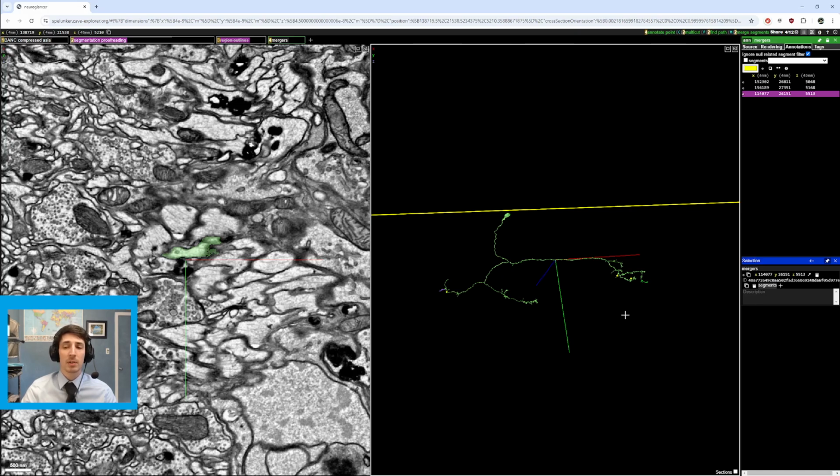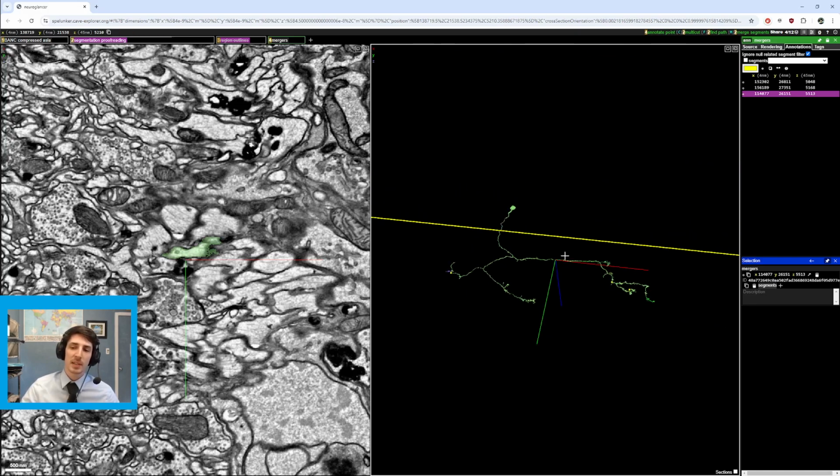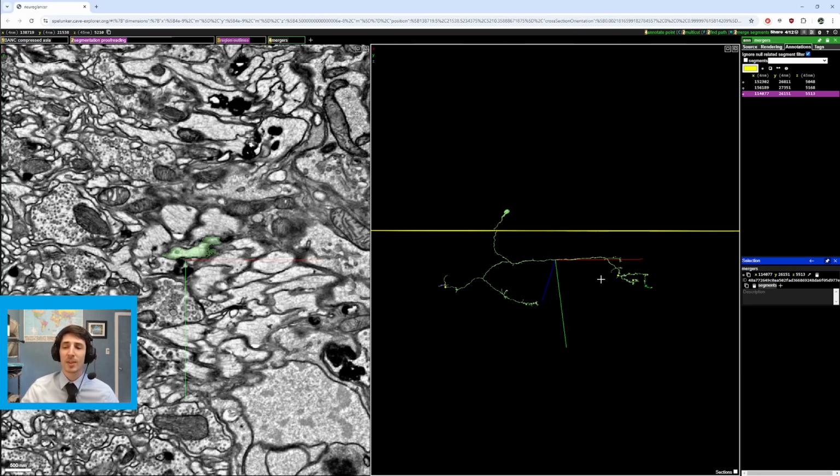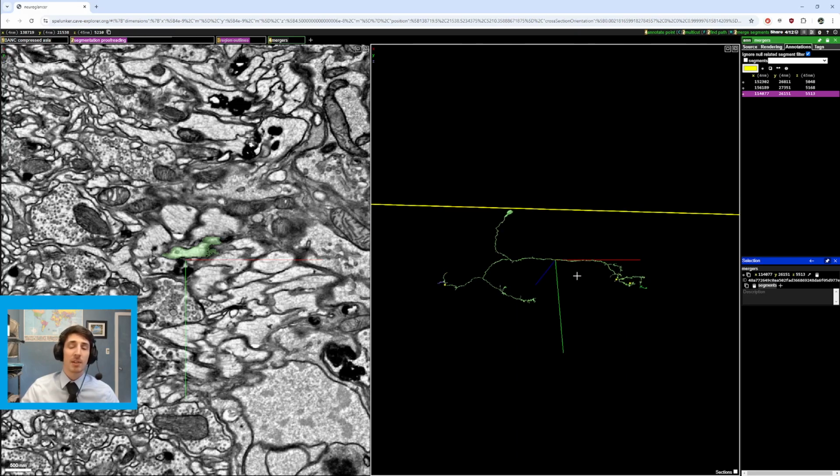In this one, we're going to go over 3 spots, how I came across them, and the order in which I came across them, and then how I was able to identify them in that sequence. So when I open this up, you can ignore my points. That is where the mergers are, but we will get to them in the order in which I found them.